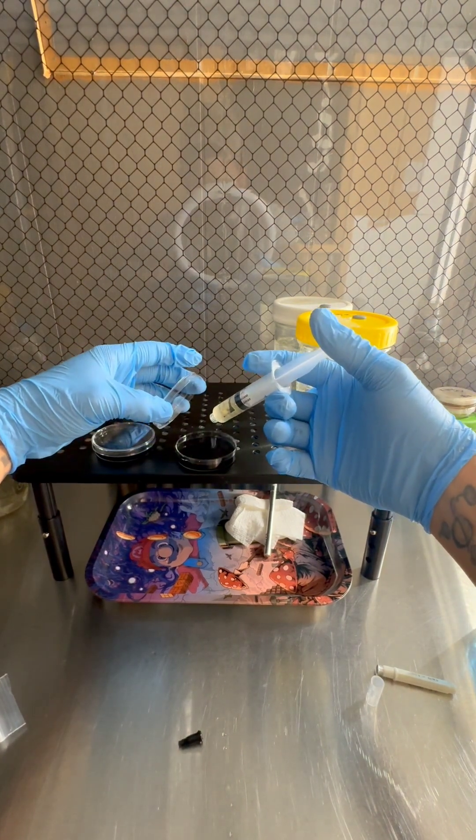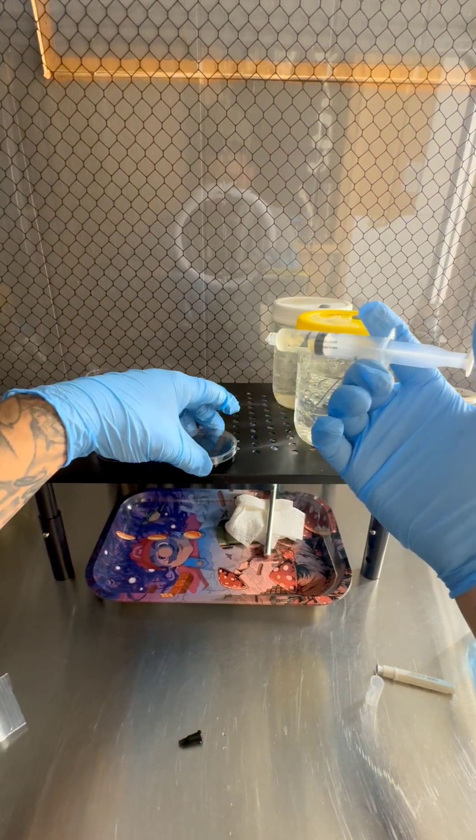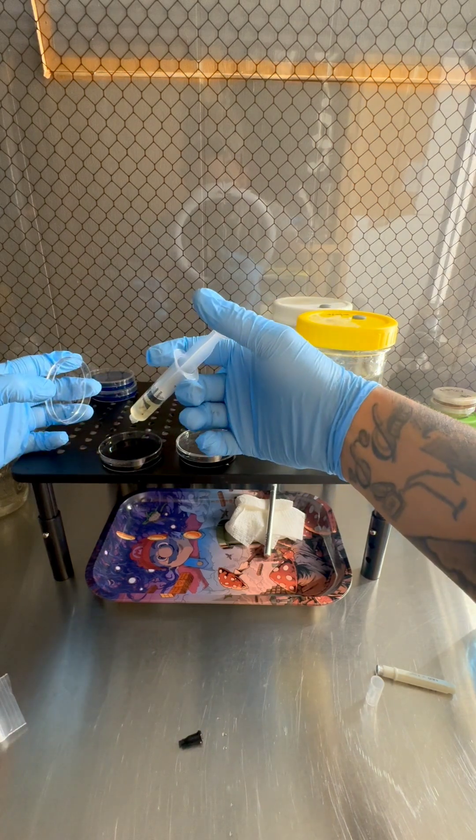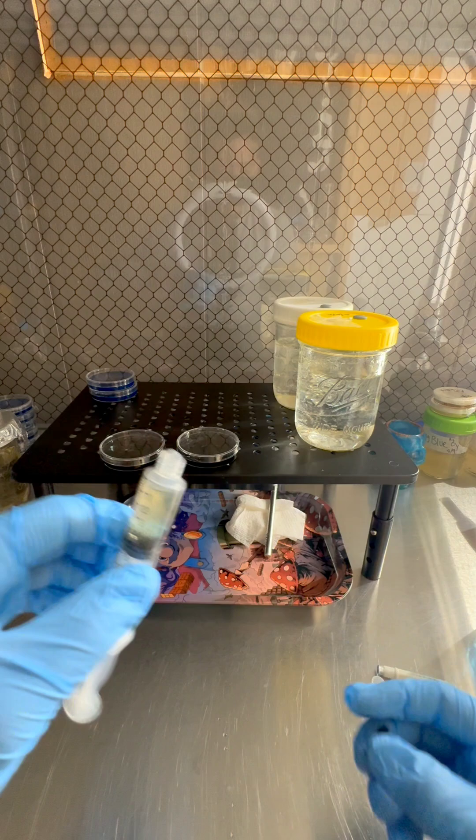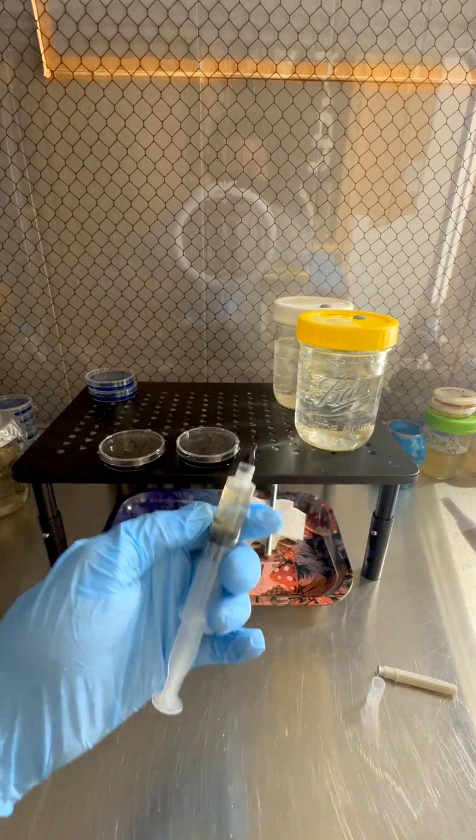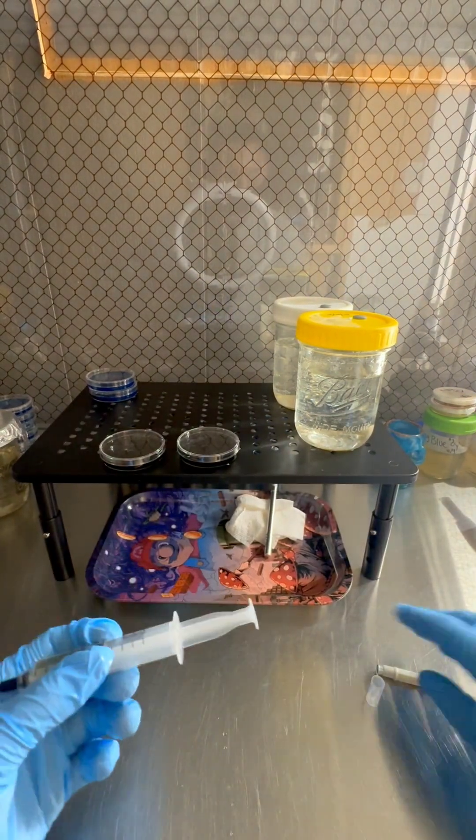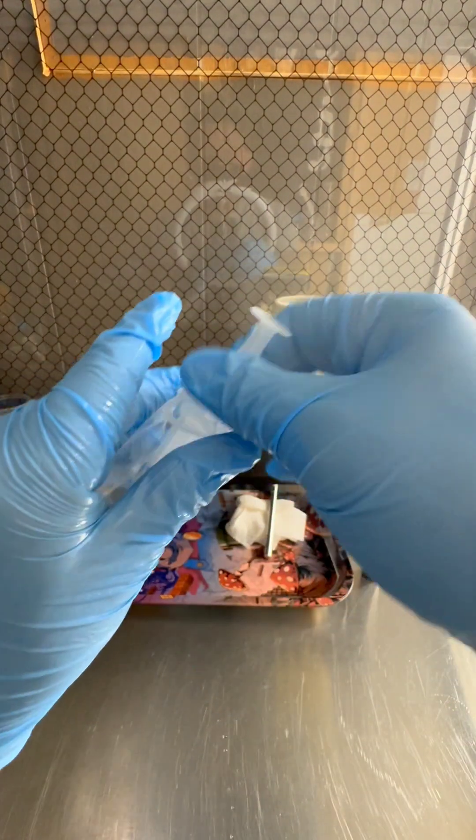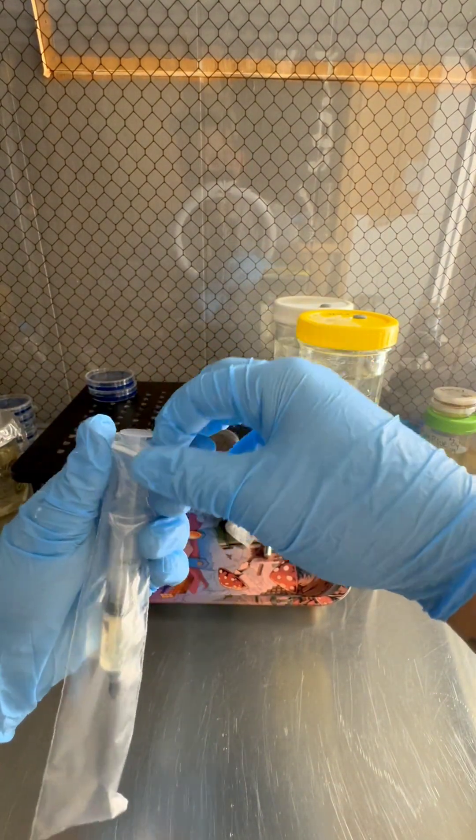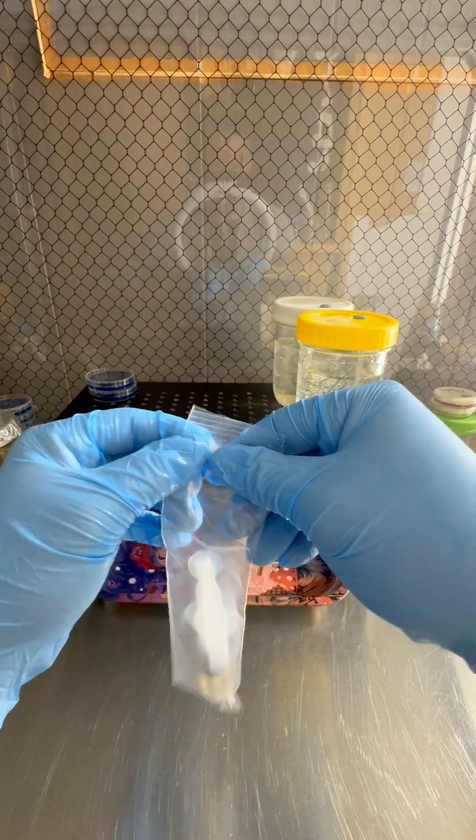All you're gonna do is get your liquid culture ready. And all you need is a couple drops. So we're just gonna - one, two. One, two. And that's all you need. And spray that down. Throw away the needle. We got plenty of needles. Go ahead and put that back.